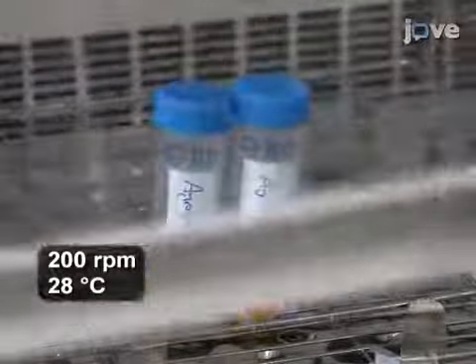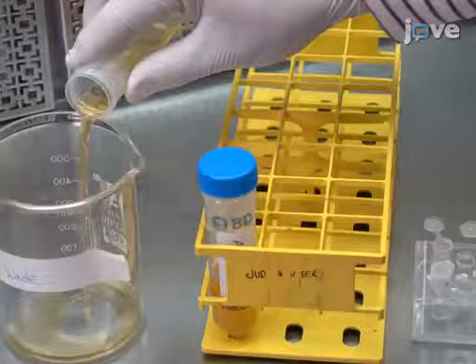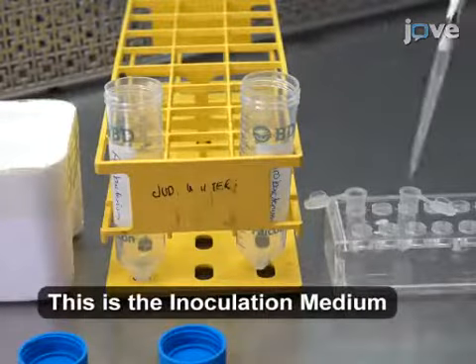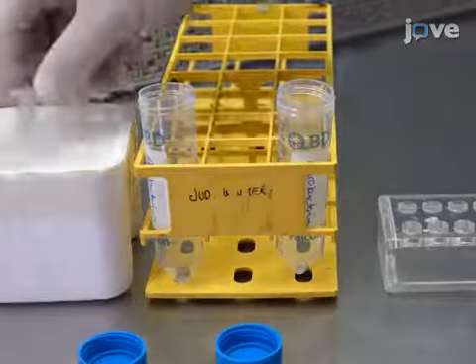Place the A. tumefaciens culture into a shaking incubator until the OD 600 is between 0.4 and 0.6. Once this is achieved, centrifuge the cells for 15 minutes at 4 degrees Celsius and 1000 times G. Decant the liquid from the tube and immediately re-suspend the cell pellet with 1 milliliter of cooled MS medium. Transfer the suspension to a clean 2 milliliter microtube and store on ice until required.